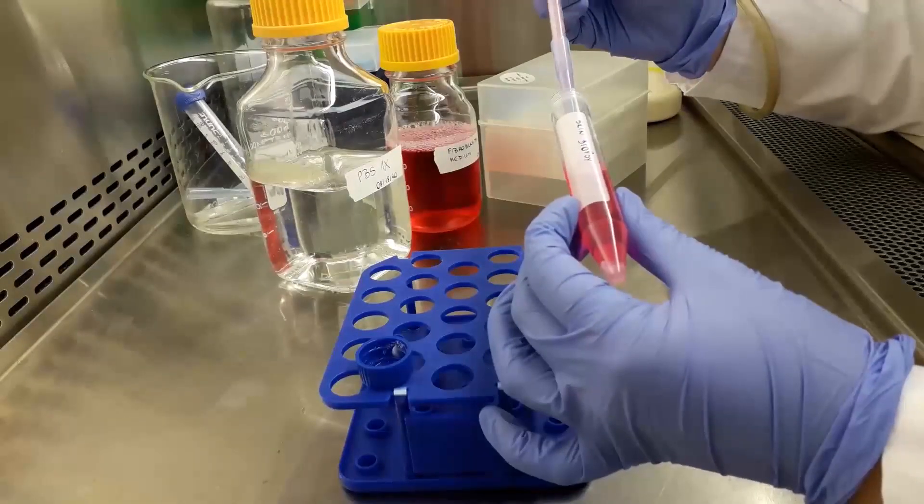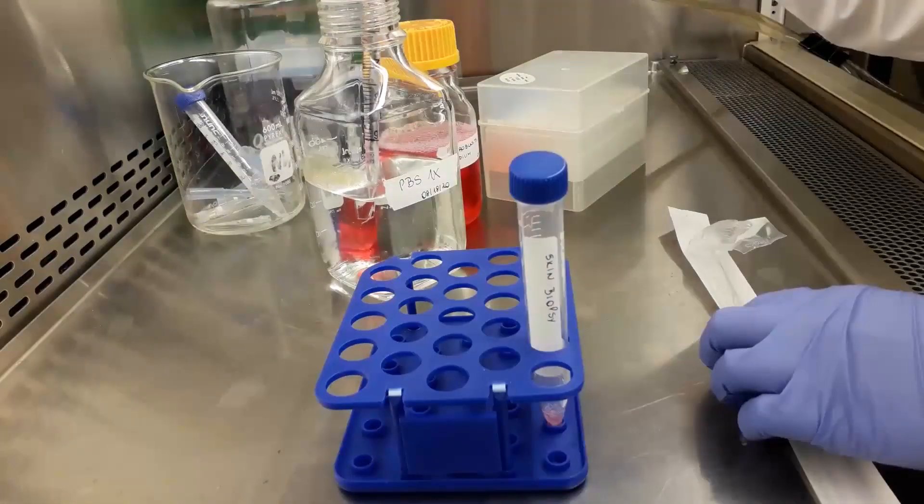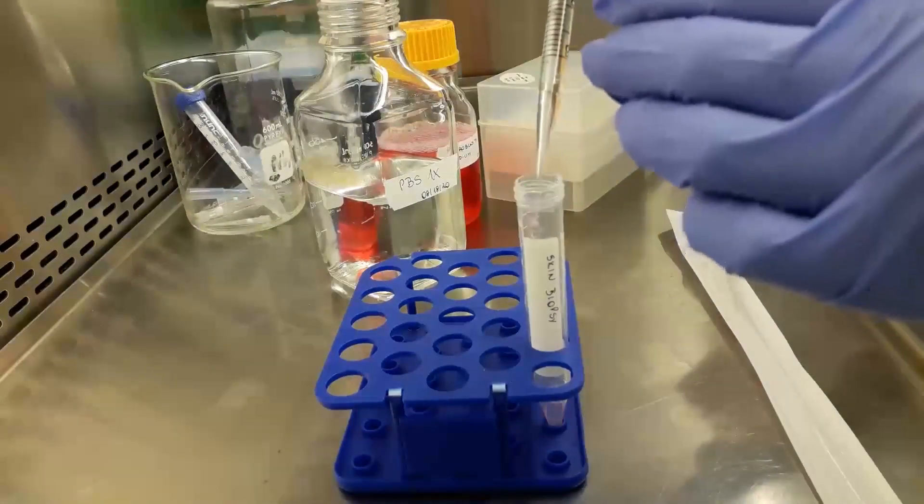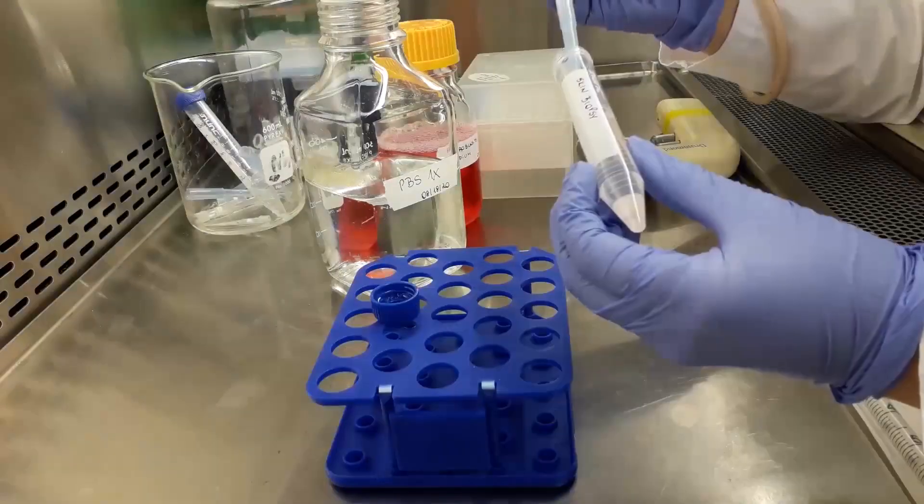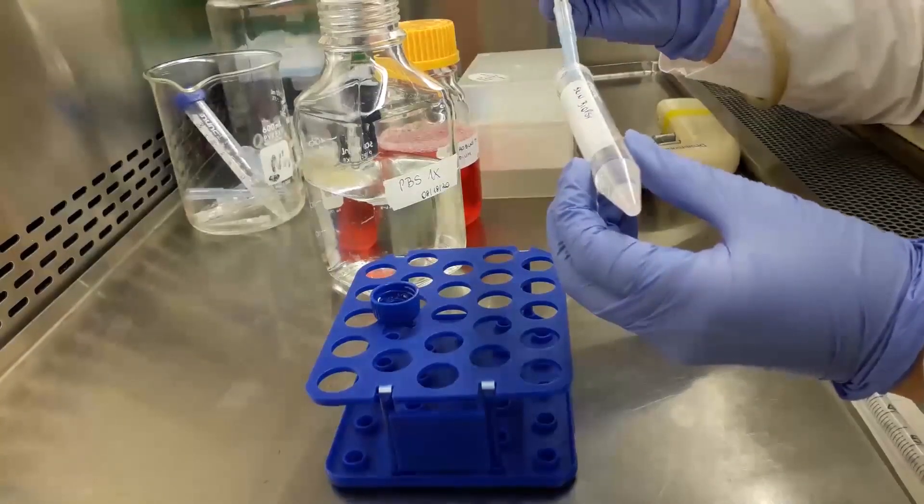Aspirate the media from the tube and rinse the biopsy with 10 milliliters 1x PBS at room temperature three times. After the third wash, leave the PBS in the tube.